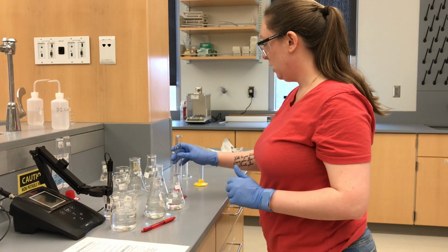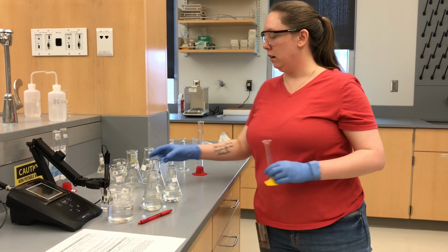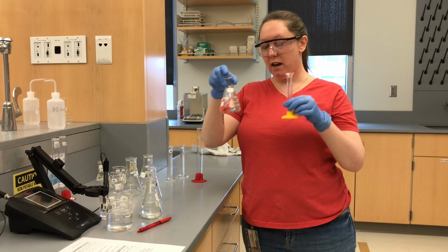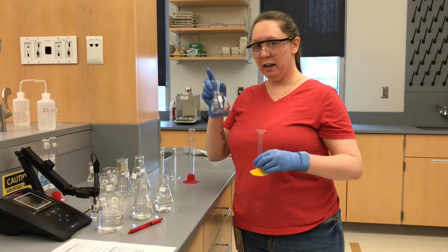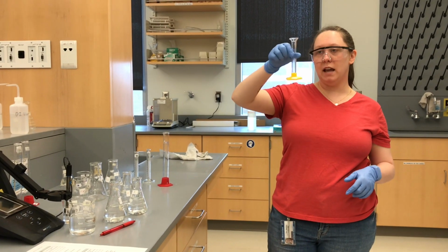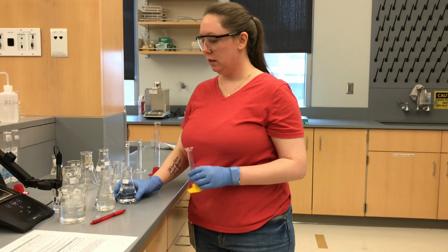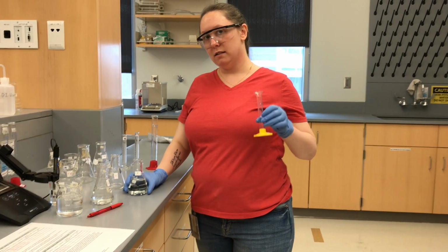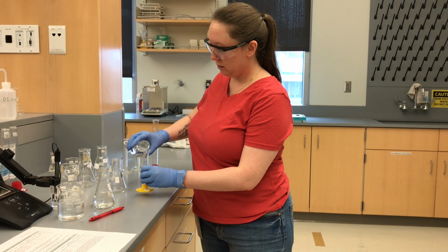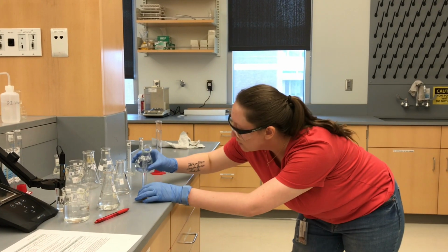All right, now we are going to an even more dilute solution, G. So we are taking 10 mils of F and putting it in G. I'm using the same little graduated cylinder. So this is a part where you might introduce some error, if there's any leftover E in our graduated cylinder.